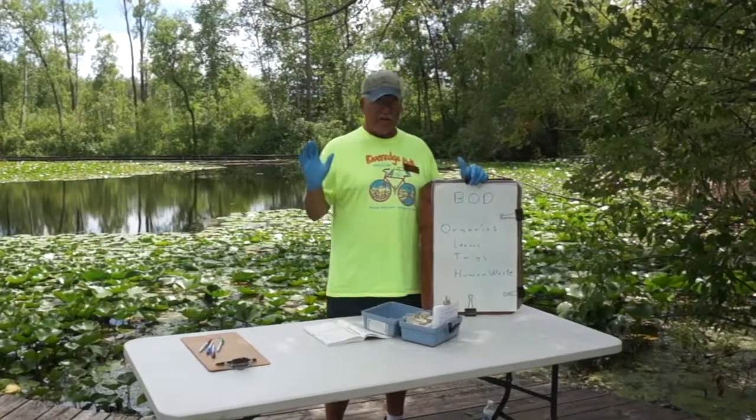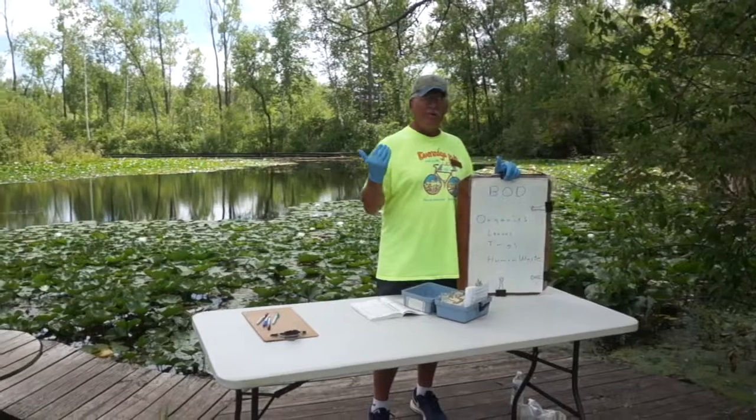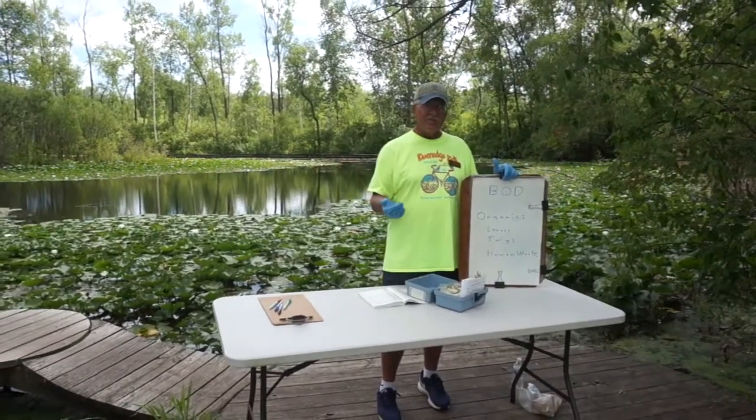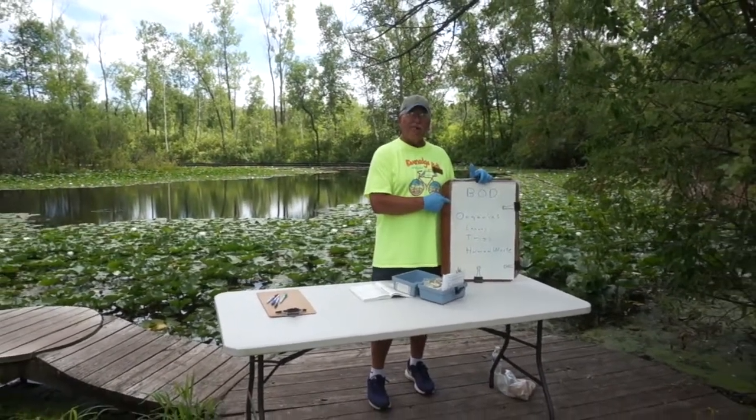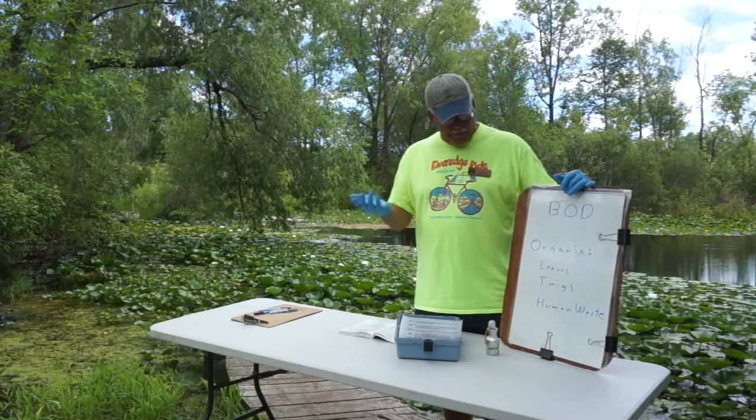Again, BOD is really a fairly simple test. And the nice thing about it is that you probably already did the oxygen test. So this just uses that information and you just have to do it twice is all that you do. So we're going to run that through you.